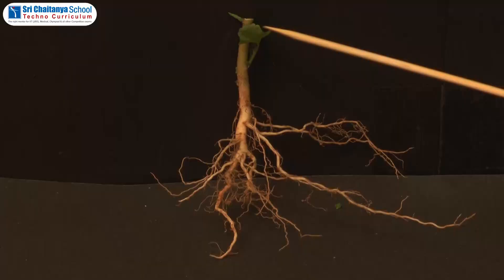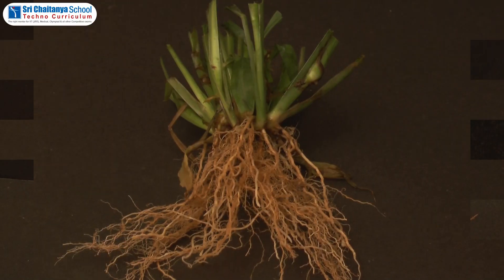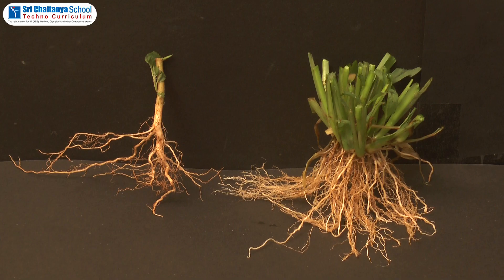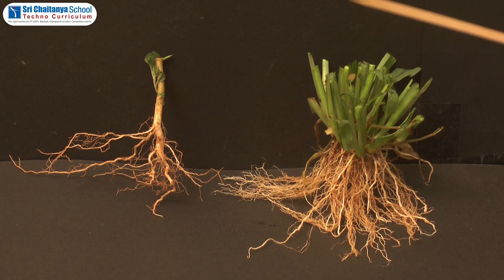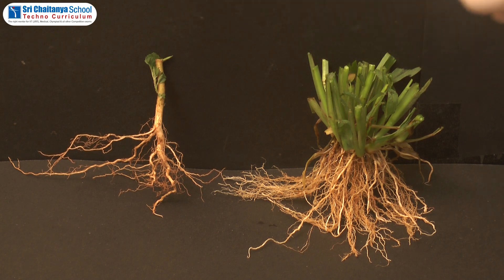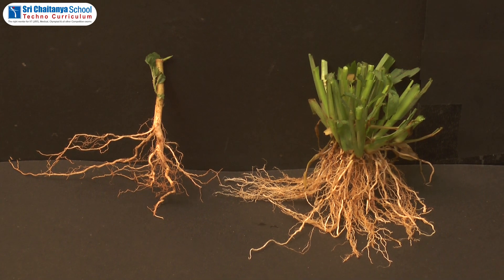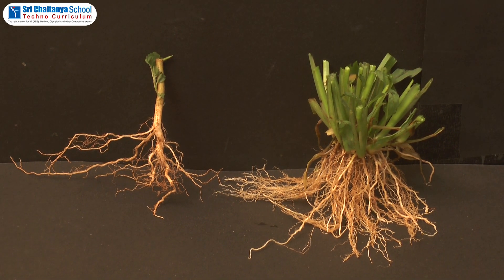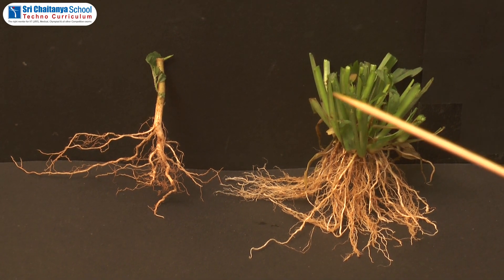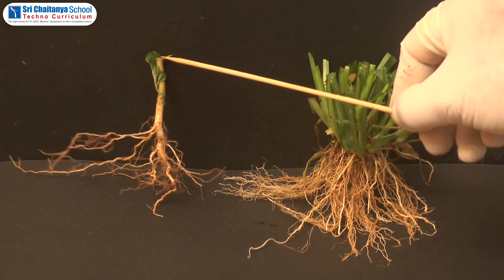Materials required: dicot plant roots and grass plant roots. First of all, take out the dicot and monocot plants from the wet soil gently and observe their roots.